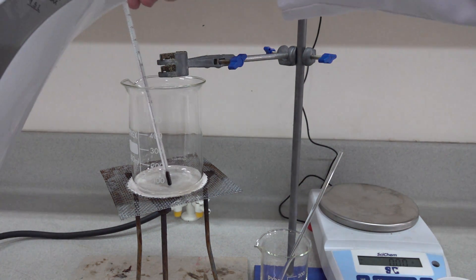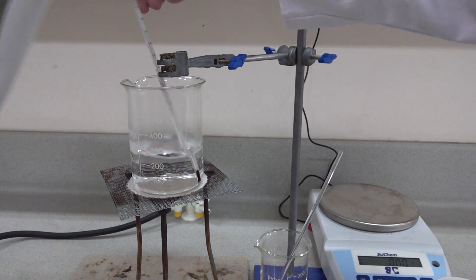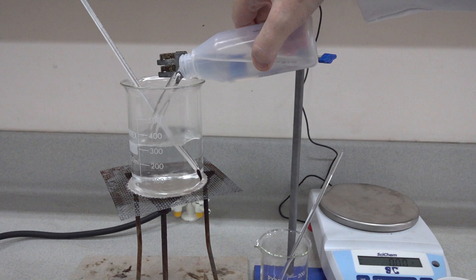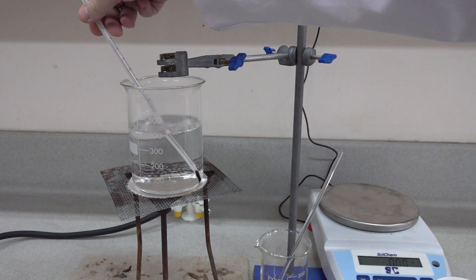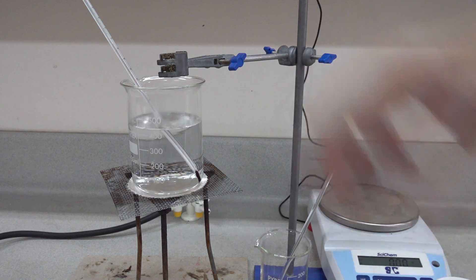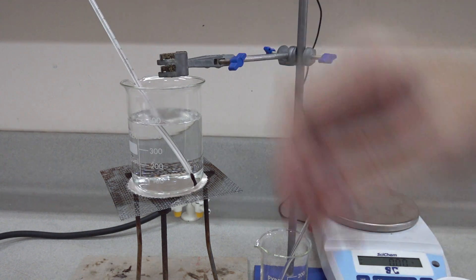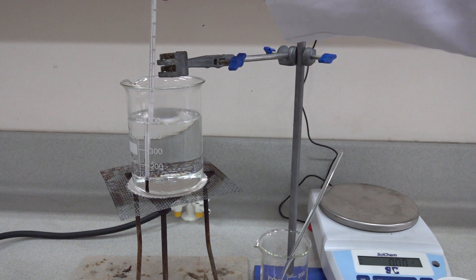We start by making a water bath at slightly more than 40 degrees C. Here we take a kettle that has been filled with distilled water and we've heated the water and it's quite hot. The temperature on the thermometer rapidly rising, and now we add to that some distilled water at room temperature. The temperature now falling — we're already at less than 60 degrees C coming down, 54, and there we're around 51 degrees centigrade.